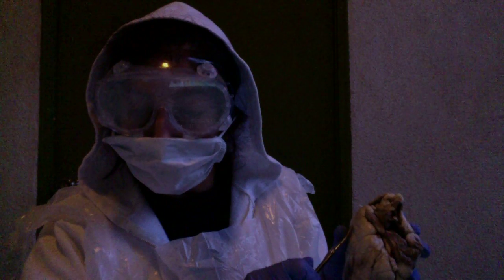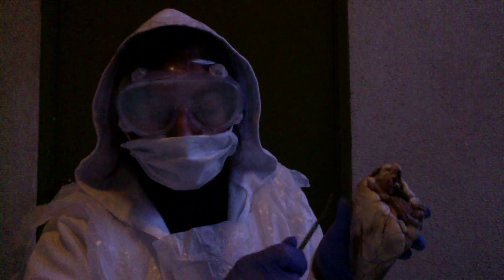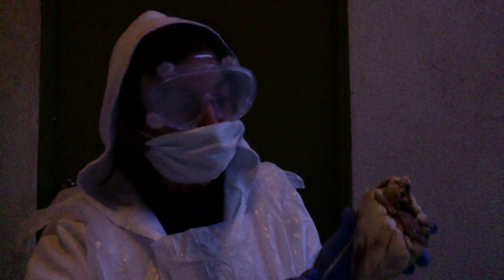When the right ventricle contracts, the blood inside it is put under pressure, and the tricuspid valve between the right atrium and ventricle closes. The only exit for the blood from the right ventricle is then through the pulmonary trunk. The pulmonary trunk is to the right of the ventricle, and the aorta is to the left ventricle, the outlet vessel. Is it oxygenated or deoxygenated? Deoxygenated blood. The pulmonary artery is one of the only arteries that carries deoxygenated blood.